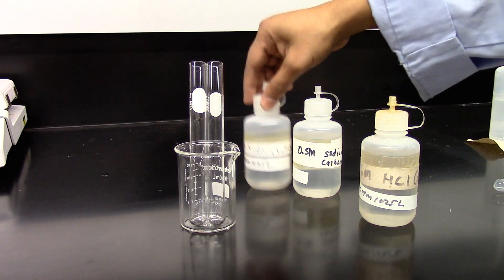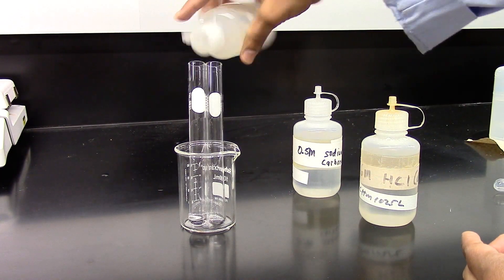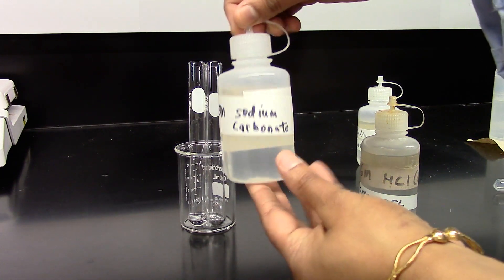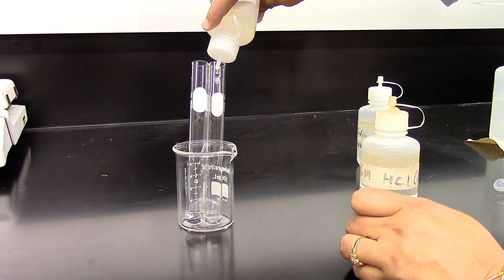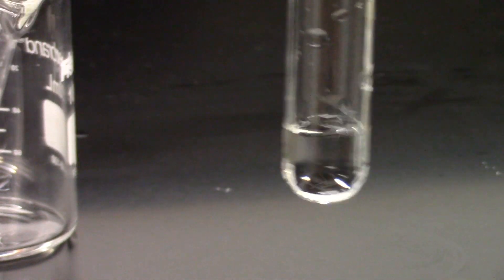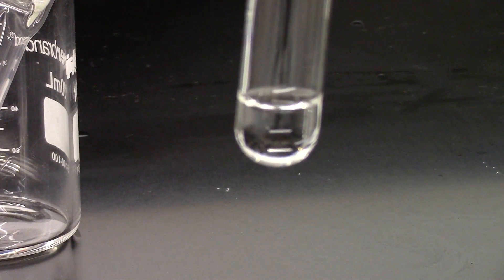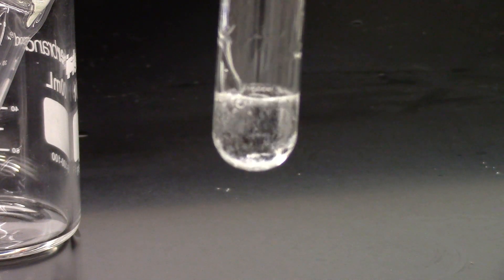I have two test tubes. In one I'm going to add 20 drops of sodium sulfate, and in the other 20 drops of sodium carbonate. This is sodium sulfate — I'm going to add a few drops of HCl and give it a mix. And that's my sodium carbonate — I'm going to add a few drops of HCl. As you can see, there's some gas evolution.